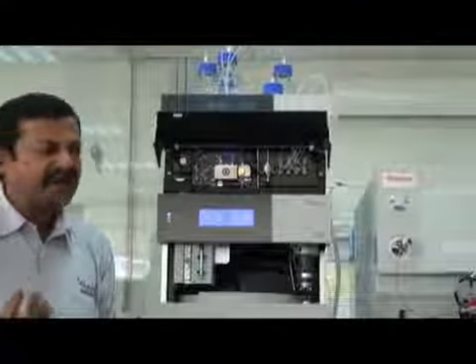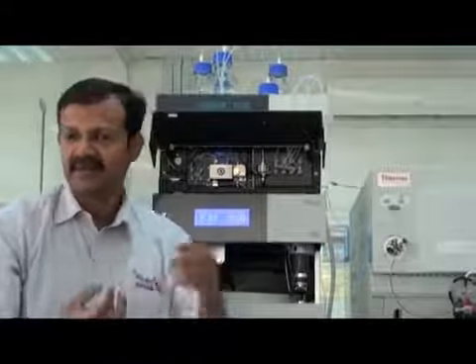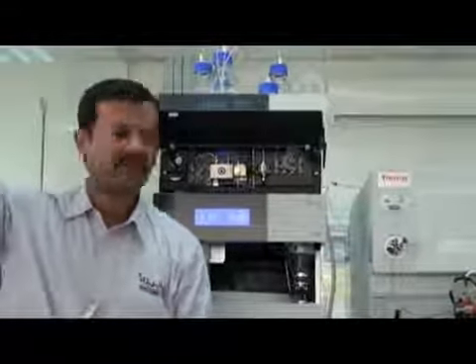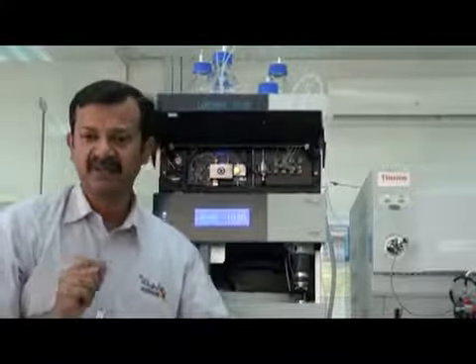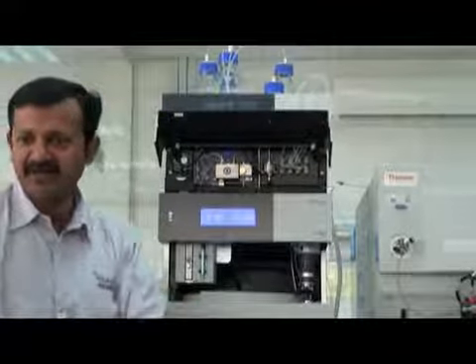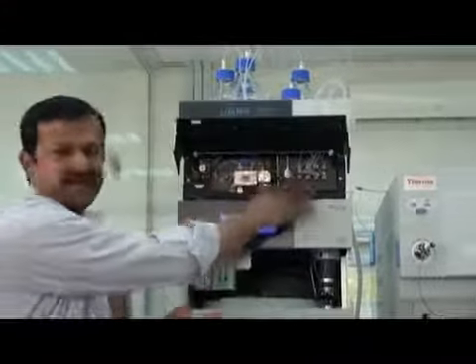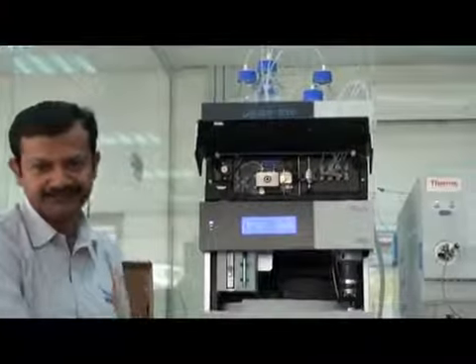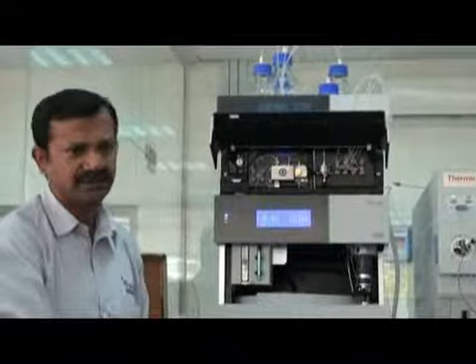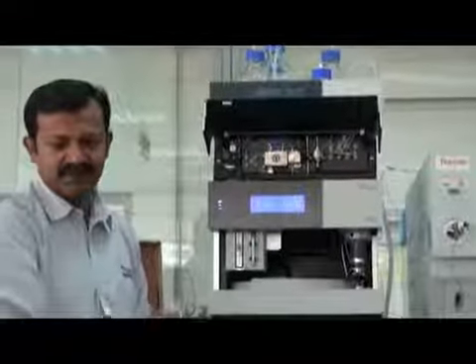Like if you want to do some cleaning of parts here, we normally put them in methanol and put them on ultrasonic, like the capillary. We need to clean it from time to time. We have to open it, put it in methanol and put it in ultrasonic. So for these things you need an ultrasonic water bath. But for degassing here you don't need it. Okay? Everything is okay? Yes, yes.